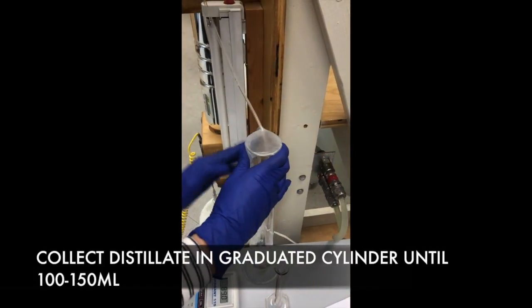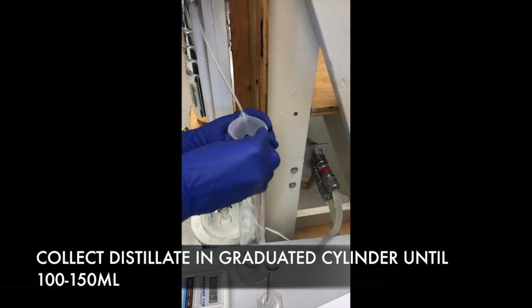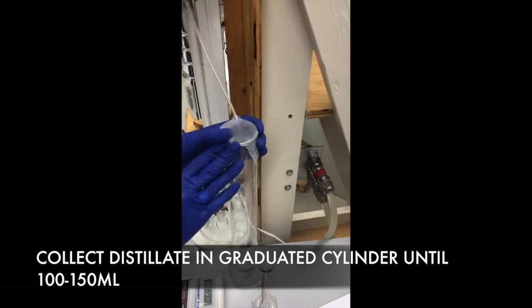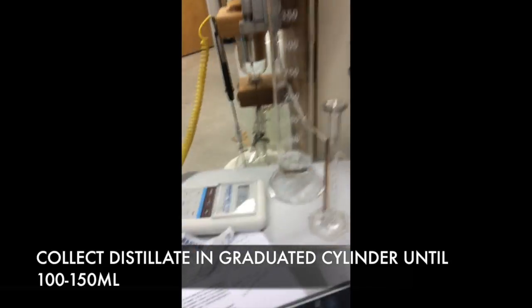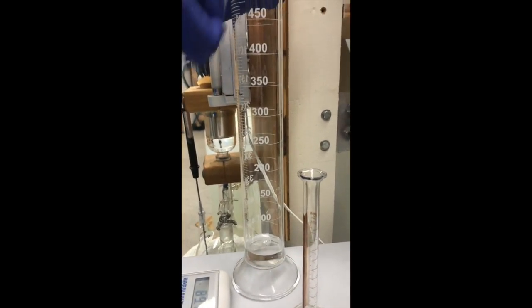In order to measure this, we'll collect the distillate in a graduated cylinder and measure volume with time every 5 minutes until we have about 100 to 150 milliliters of the distillate. We'll also be taking temperature readings at the top and bottom in 1-minute intervals.